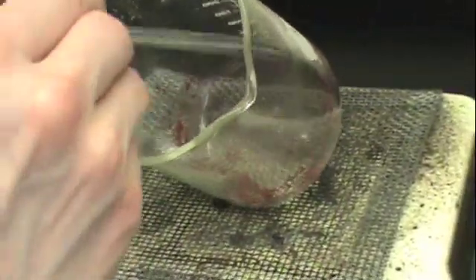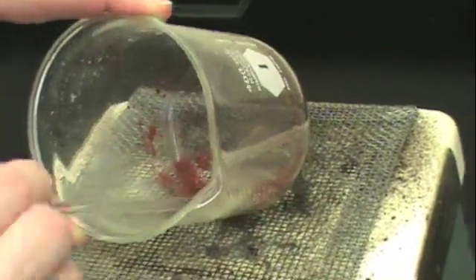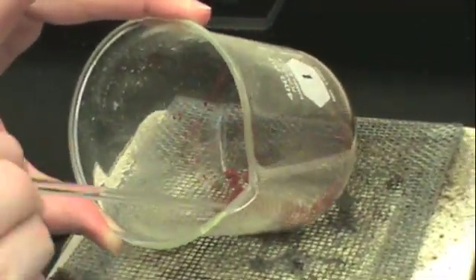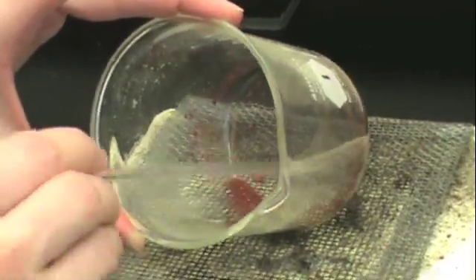When you notice that there are no longer any clumps in your beaker and the powder is fine, you can remove the beaker from the hot plate.